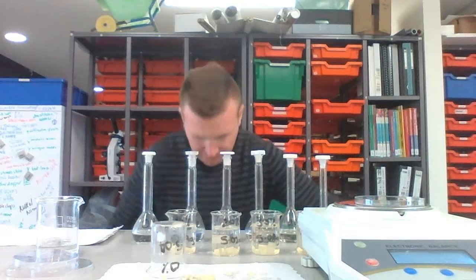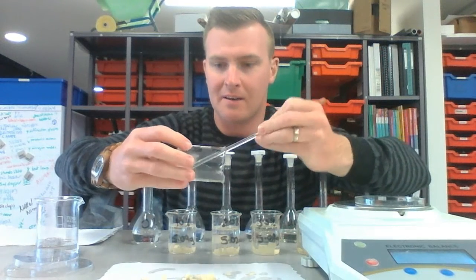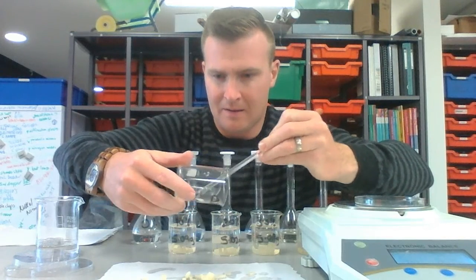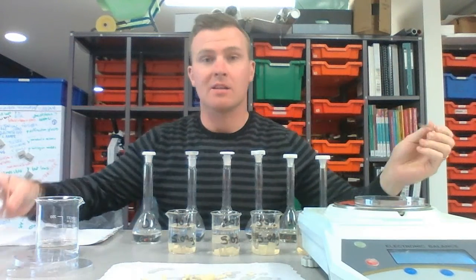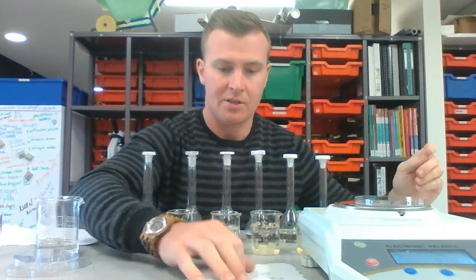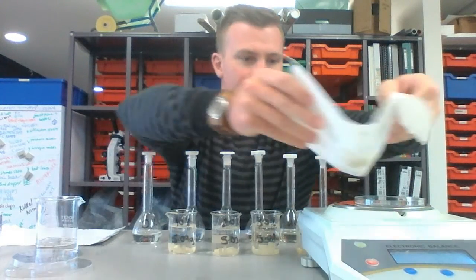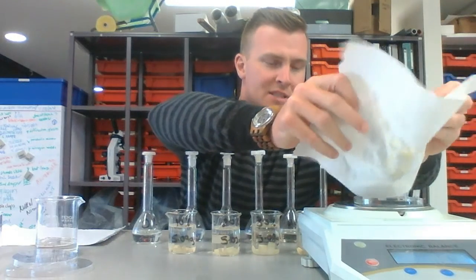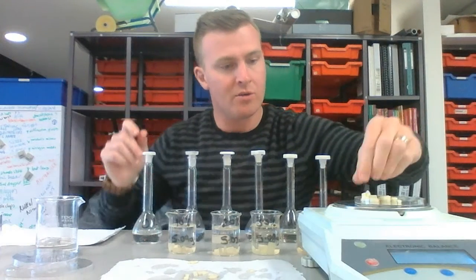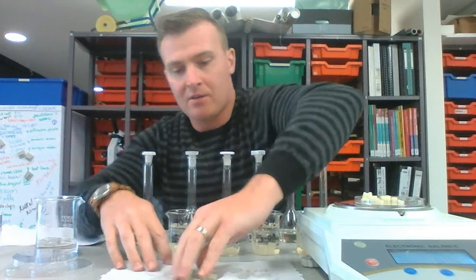I'm going to get a stirring rod. Okay, so the stirring rod will make this a bit easier. Get those out. Wonderful. So the paper towel is going to soak up all the excess water. Then, just drying those, I'm going to place these pieces of potato into the Petri dish on the scales. Now this was a 0% solution, so the potato is hypertonic to the water surrounding it. So what we're hoping to see is the potato increase.